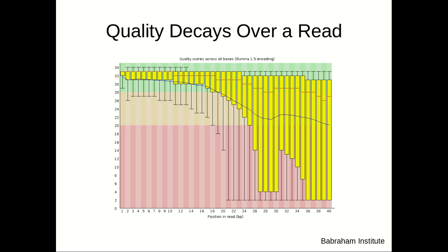So one general principle is that quality will decay over a read. So I'm going to have higher quality at the start of a read and lower quality at the end. And this really becomes amplified the longer a read is. So just something to keep in mind there is that you want to have that drop-off in quality be acceptable. And this would be an example of an unacceptable drop in quality.